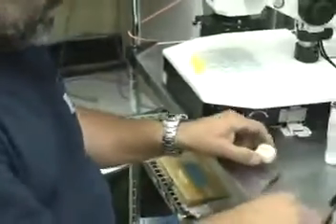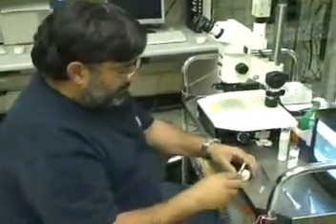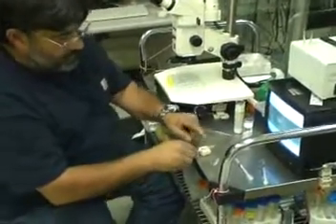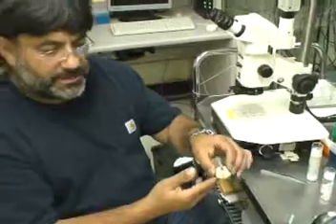The other thing we need is a piece of clay — modeling clay. A small block like this will be good. We need to put the capillary there to form a little wedge. That's going to keep the capillary in place so we can manipulate it under a microscope.